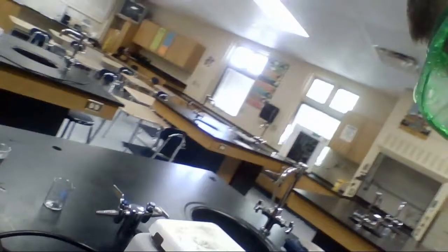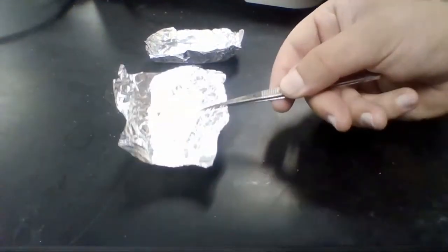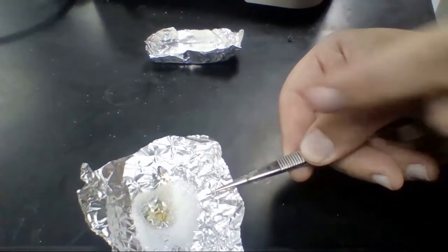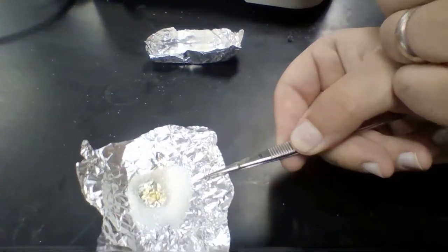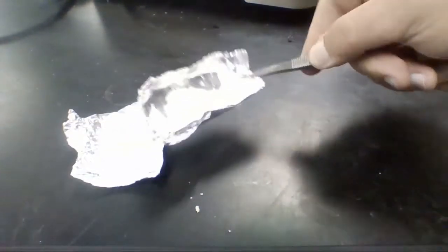I'm going to take it off before anything burns. I'm going to turn off the hot plate and unplug it. Now I'm going to angle this the best I can. Hopefully you are able to see that it burnt through a little bit. You can see it right there. It's starting to get a little brown, a little liquidy. The salt turned a little darker, but it's just still salt. It's still all dry.